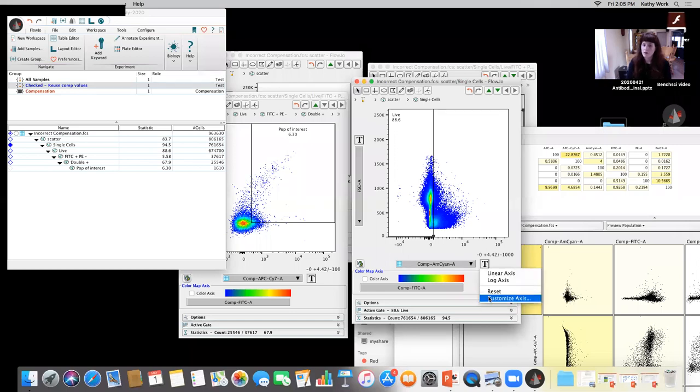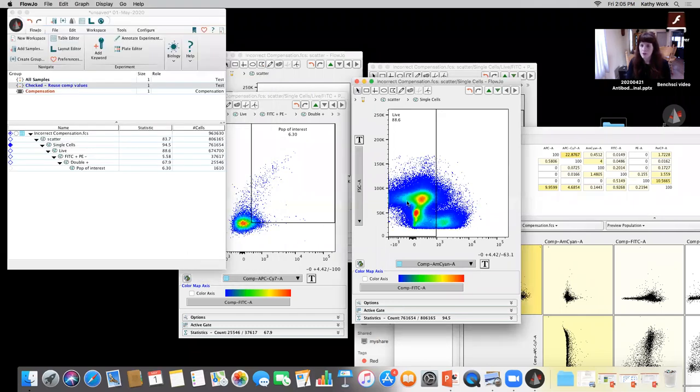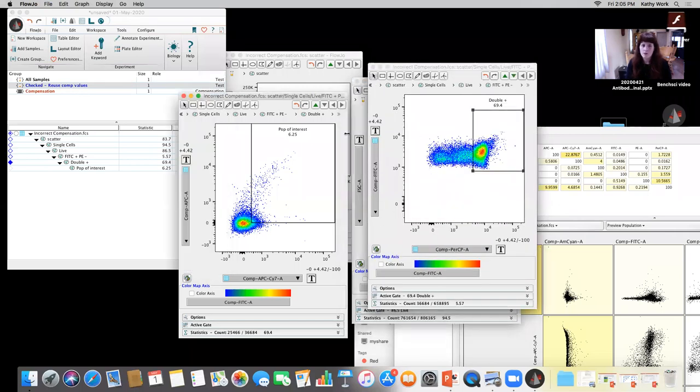So if I go ahead and adjust this transform, because I no longer have all of those extreme negatives, I'm able to pull out much better now. I'm actually able to pull out in a much more defined way where my negative and my positive fall. Okay. Then from there, I can go ahead and look at the rest of the populations. Okay.